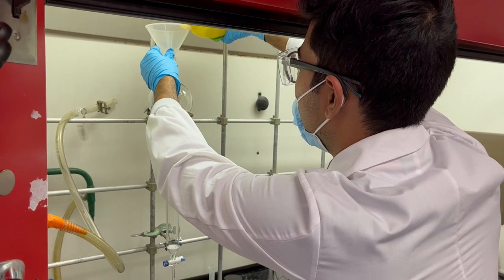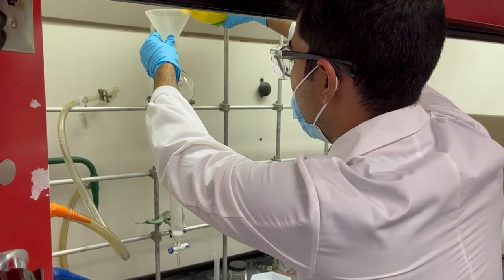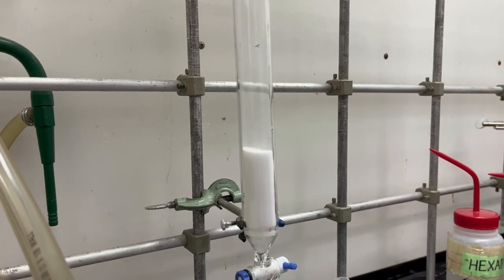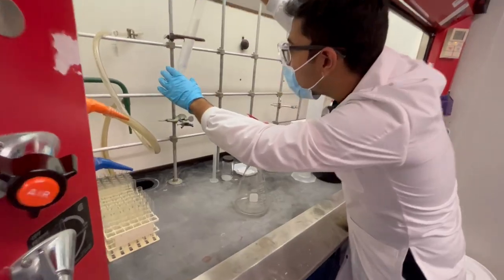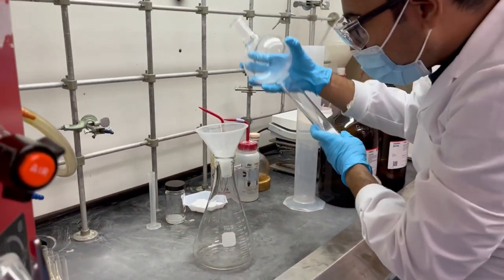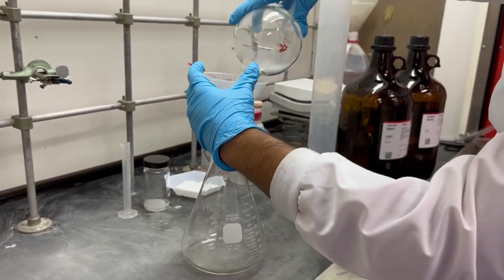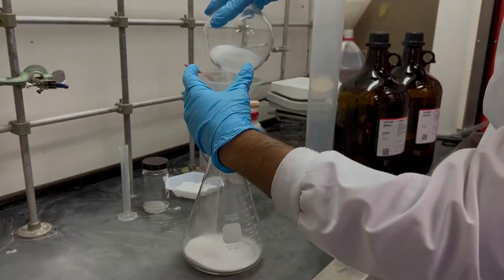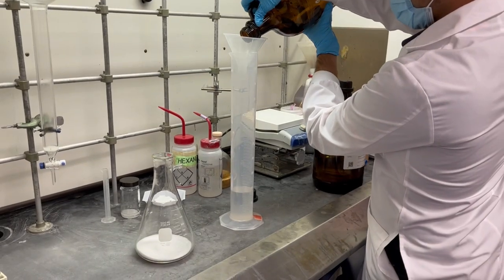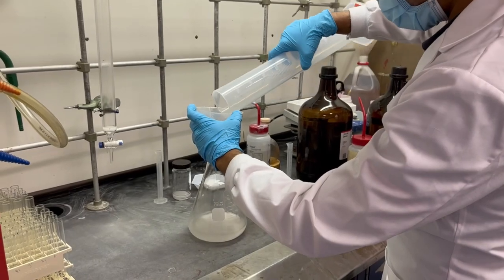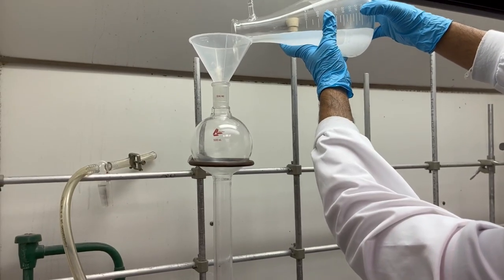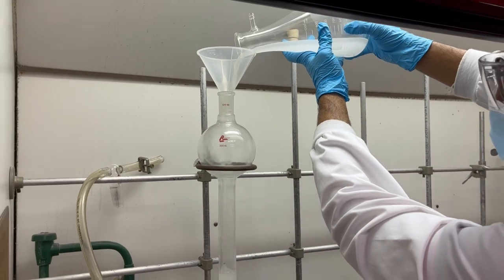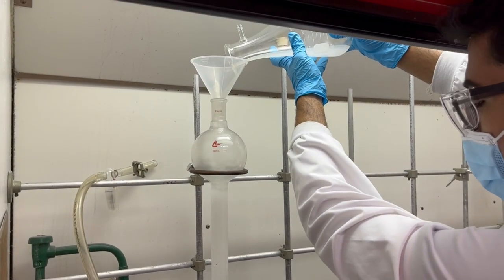The first thing to do is the addition of silica gel, where we highly recommend using masks and gloves in our lab. The solvent system was predetermined using previous experience and theoretical knowledge. The stationary phase is then combined with the mobile phase to make a slurry. Please note there are different ways to pack a column. In our lab, we prefer to use the slurry method as it provides a safer and easier way to introduce the silica with minimal air bubbles.